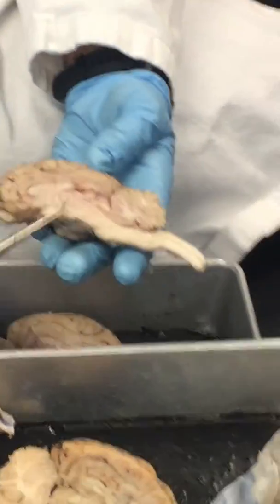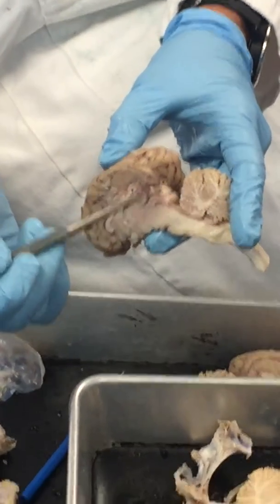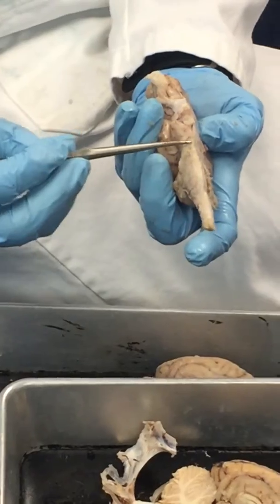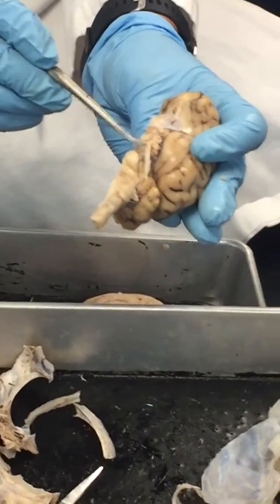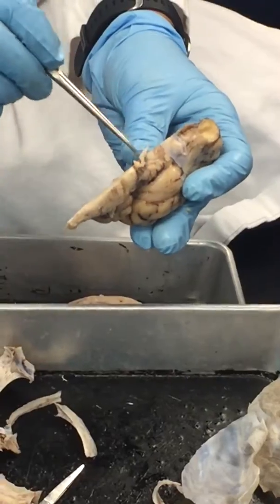Okay. Our midbrain is this section right here. So the superior and inferior colliculi are on that midbrain. Your oculomotor nerve, where's your oculomotor nerve? What happened to it? So here's the midbrain. That's not it. It belonged up there.